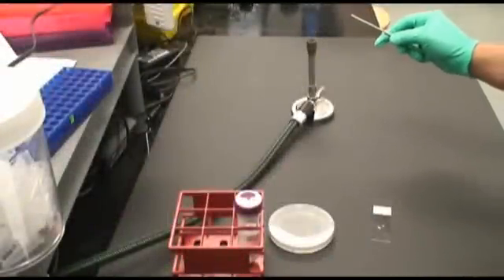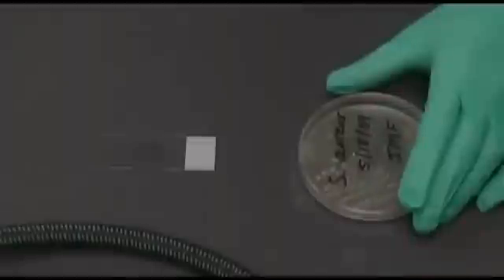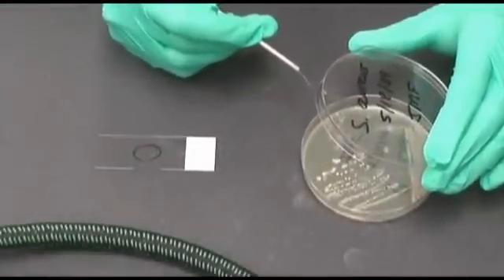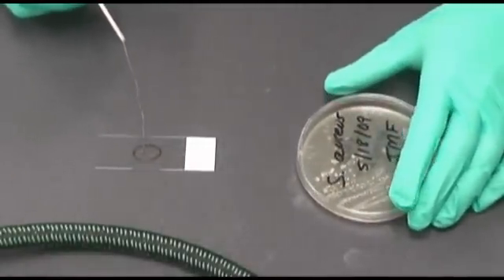Sterilizing the loop between each transfer, add a small amount of gram-positive and gram-negative bacteria to the same slide, ultimately smearing the two bacteria together.